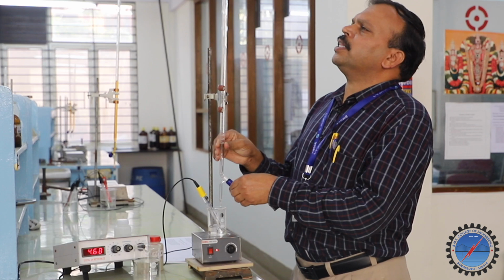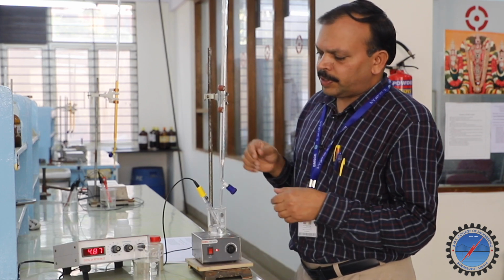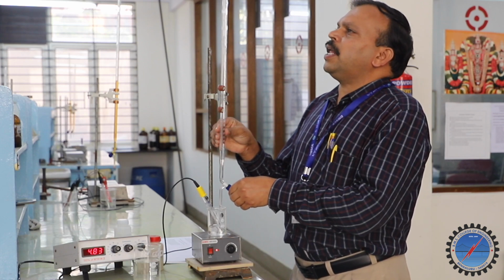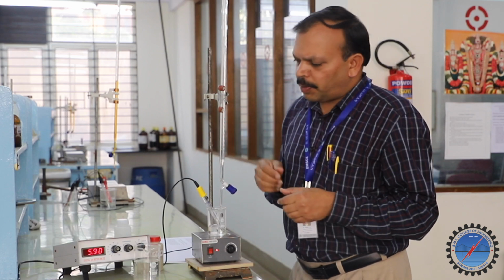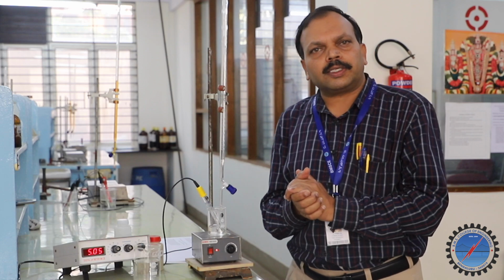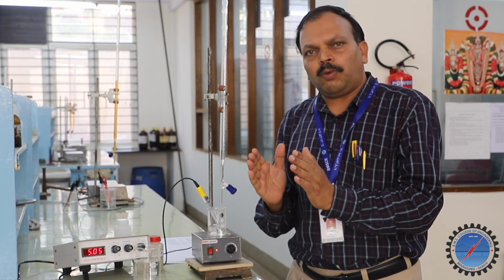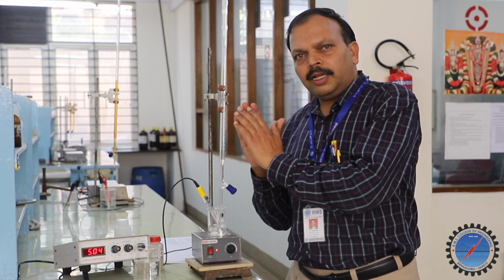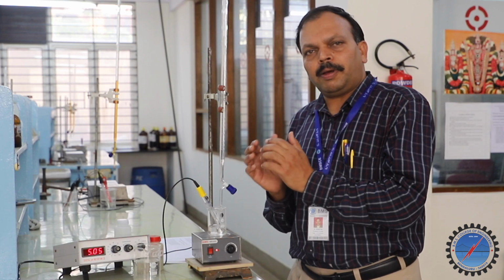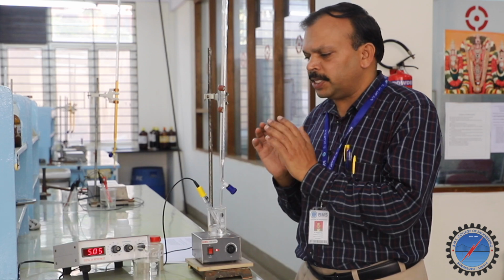See, I am adding another 0.5. It goes to 4.83 pH. Like this, another 0.5, we are going to get 5.05. So you have recorded the pH value from zero volume of NaOH, without adding, and for every addition of 0.5 ml of NaOH the corresponding pH value we are recording. That is very important in this experiment.